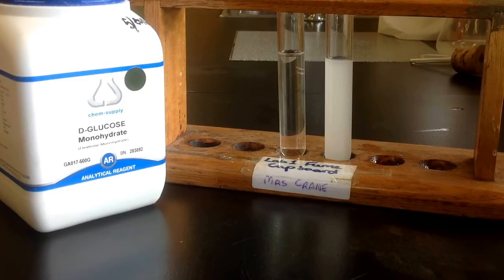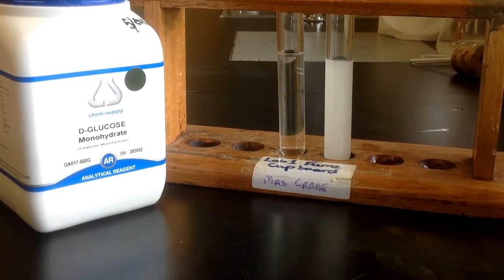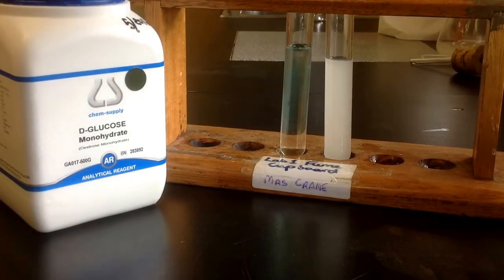The cloudy tube here is my alcohol solution that I've made, and the other one is just a really quickly mixed up solution of the glucose. It's not perfect. I didn't weigh it out, but I just wanted to show you the difference in the two tests and see whether it's the Benedict's solution that's not working or that there isn't any sugar in the other container.